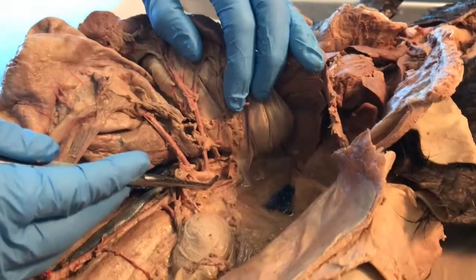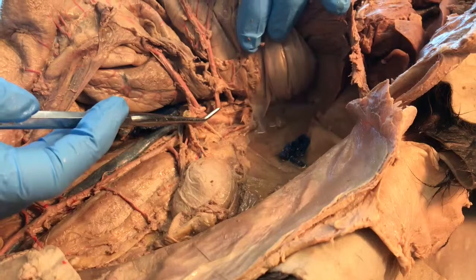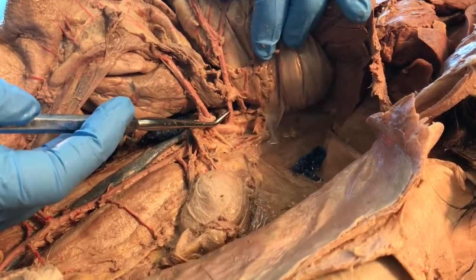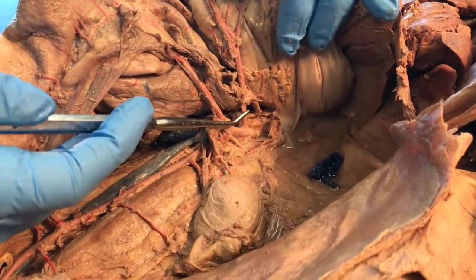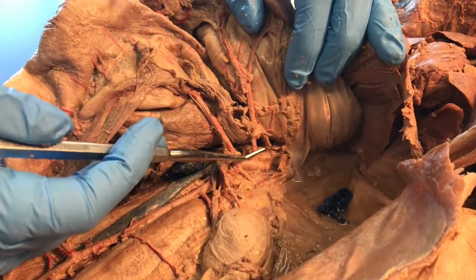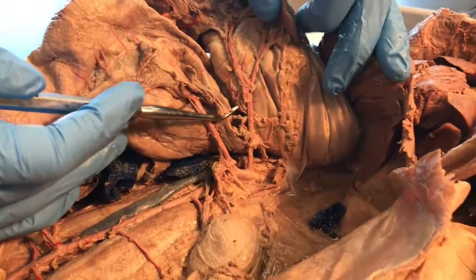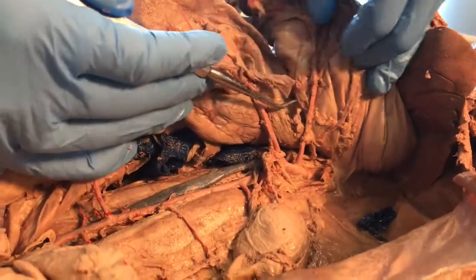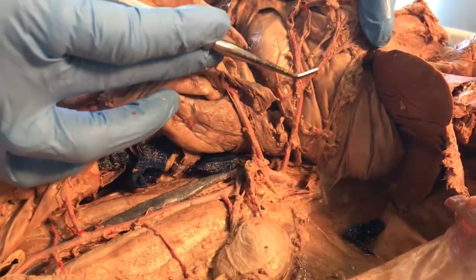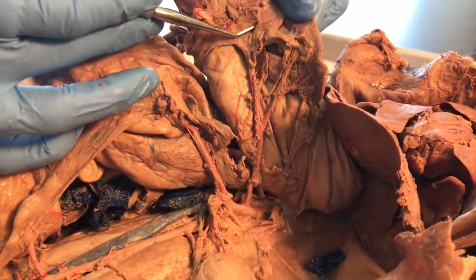Now let's begin looking at the first blood supply under the diaphragm. Here is the abdominal aorta of the cat. The first trunk or branch is the celiac artery, and we have three branches to find: a hepatic artery, a gastric artery, and a splenic artery. If we look at the one we can see best, we can trace it right up to the spleen — so these are the splenic arteries going to the spleen.